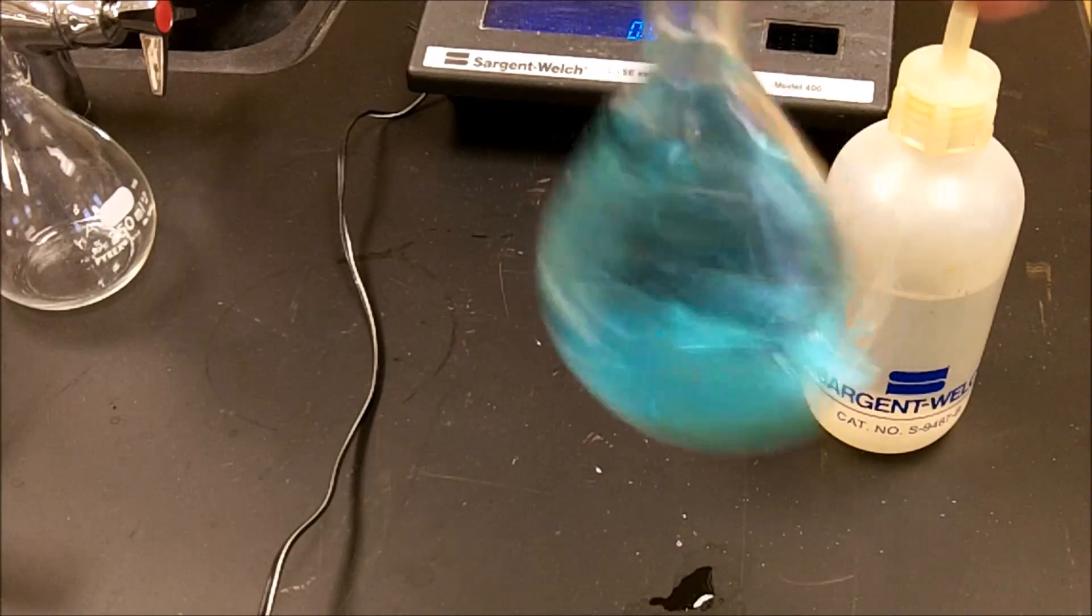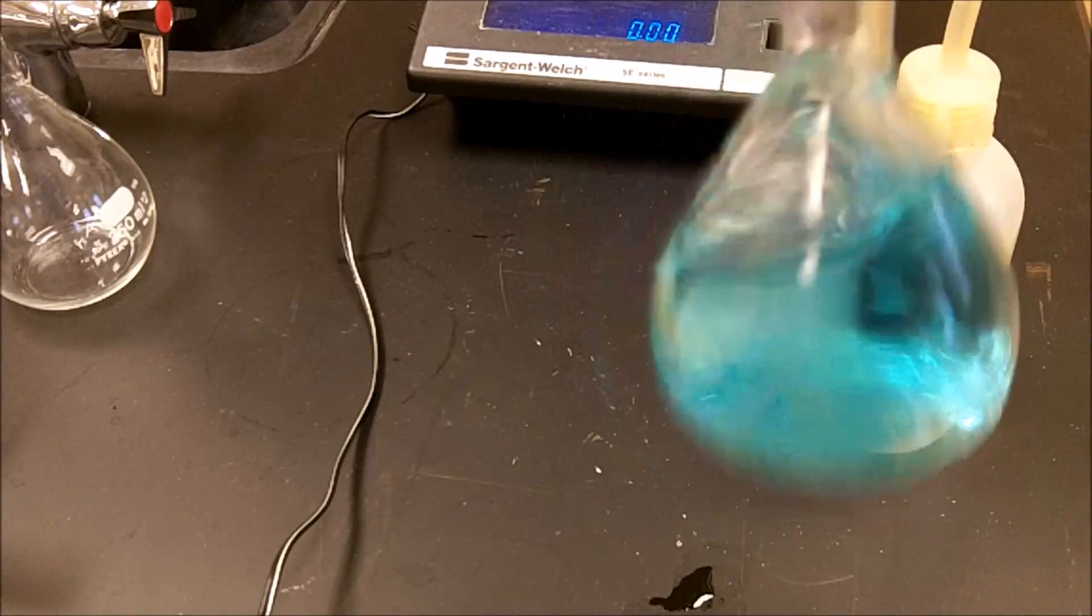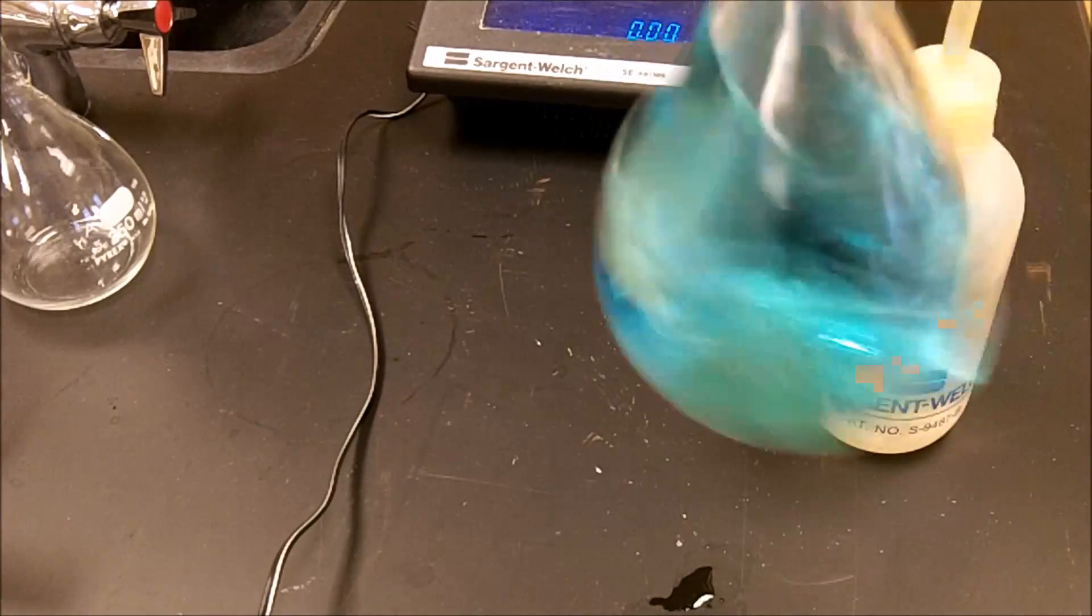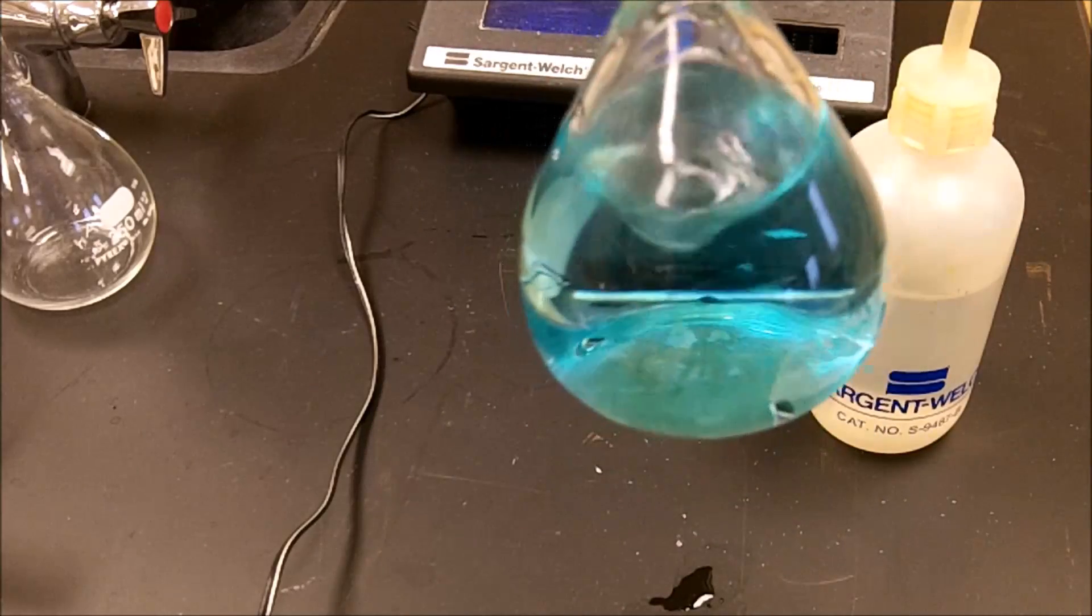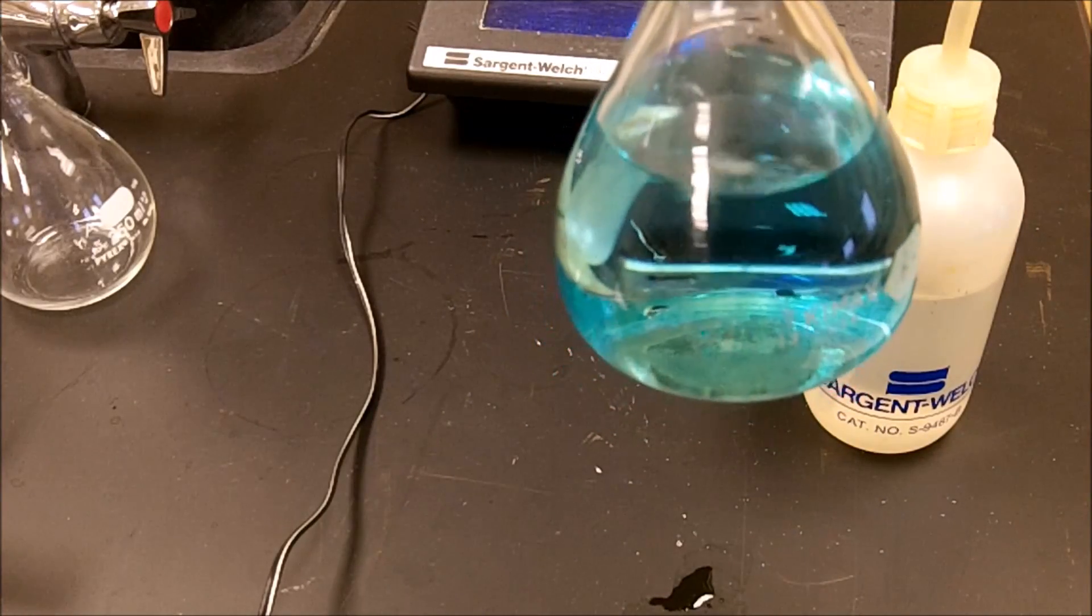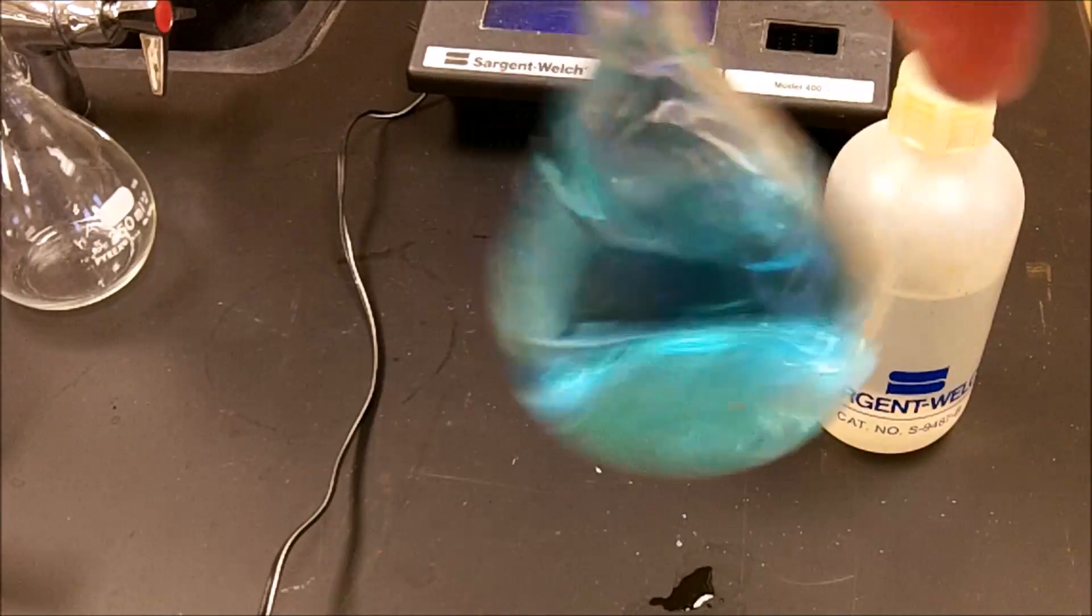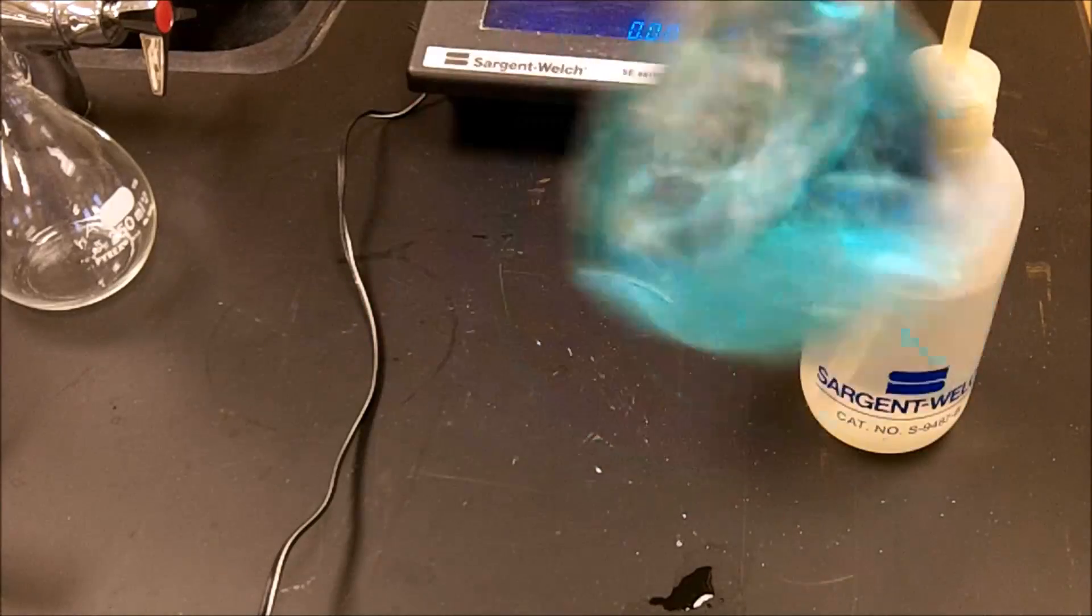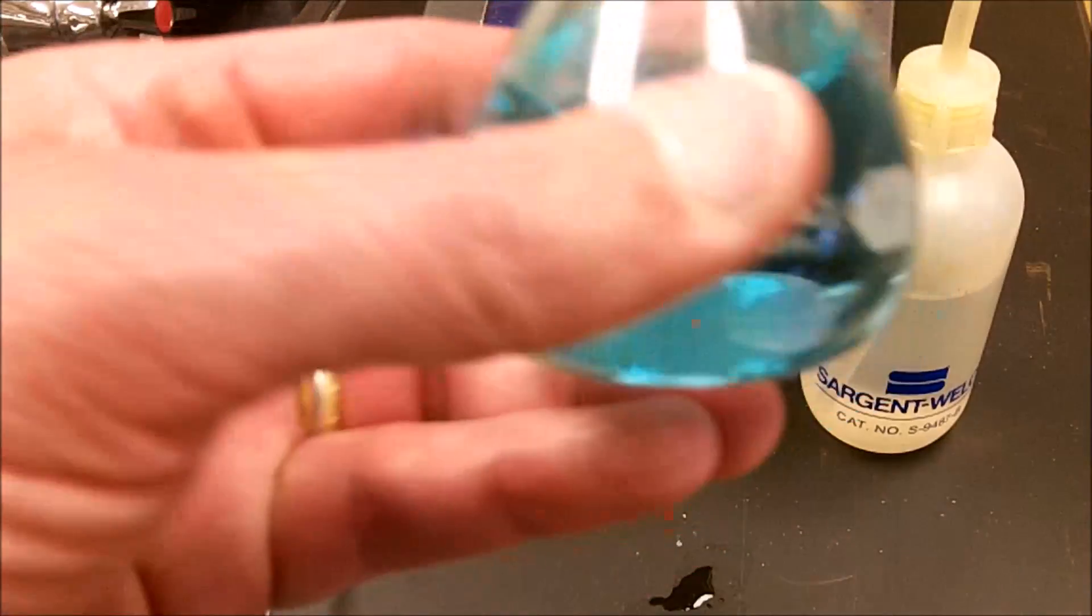And when I'm satisfied, then I'll top this off. So there's still some crystals in there. Just kind of carefully swirl it around. Don't stick a stirring rod in here or anything. Just give it some time here. It will dissolve. And we're getting really close. And as I need to swirl that, and there are all the crystals that have dissolved.